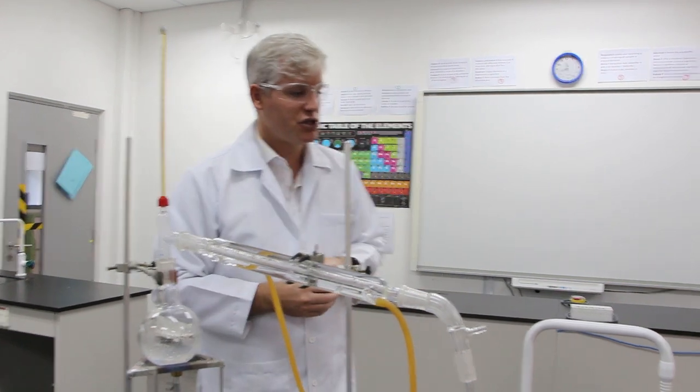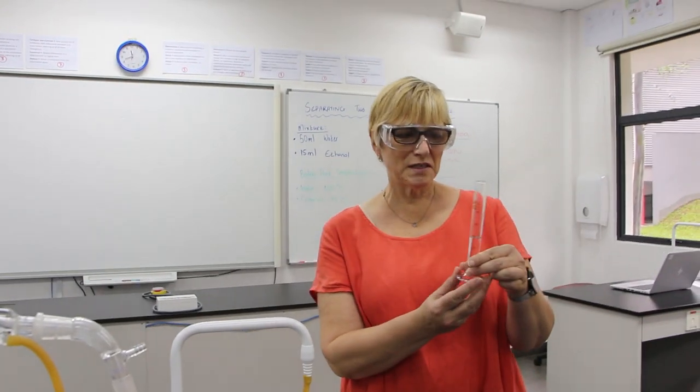Ms. Ginger, how much ethanol do we have there? You can see that we have almost exactly 15 milliliters, which is quite delightful because that's what we started with. So it's clear that it is the ethanol that has evaporated and then condensated into our flask, and the water is still in the original container.